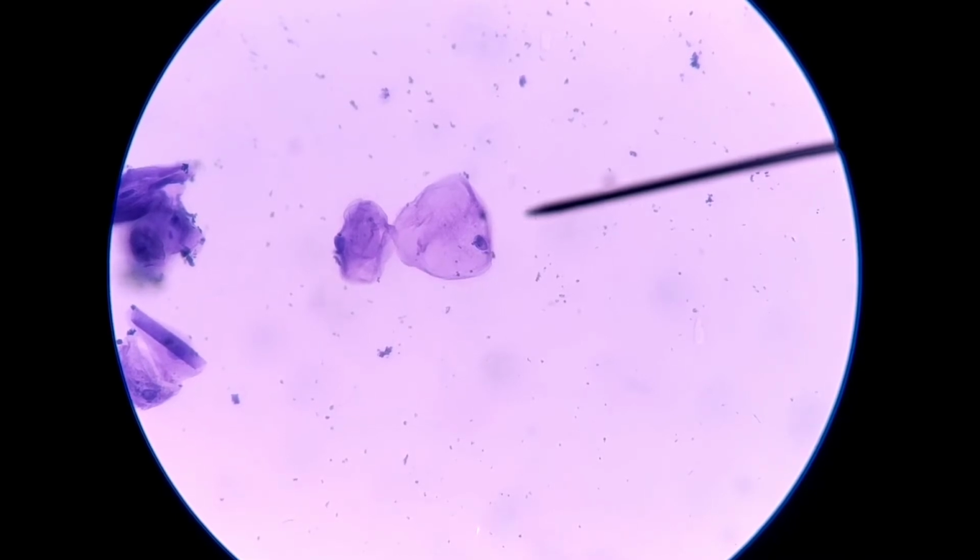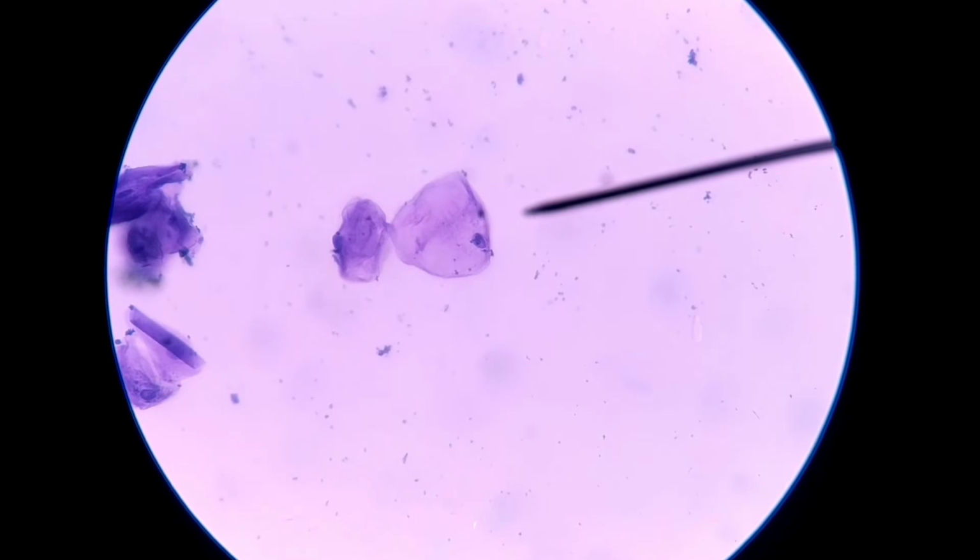And if you look to the right-hand side nearest to the pointer, the nucleus is observable. And so the nucleus is kind of to the side of this cell. And now we're going to go to oil immersion, which is the highest power, 1000x. And we'll be able to see these cells in even more detail. But before we do that, I want to show you guys how to apply the immersion oil and understand how the oil works. So we'll come back to this in just a few minutes.